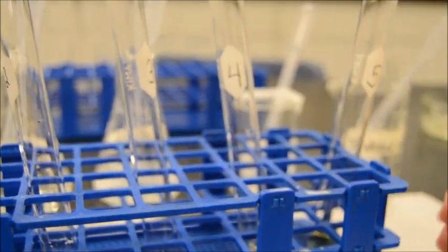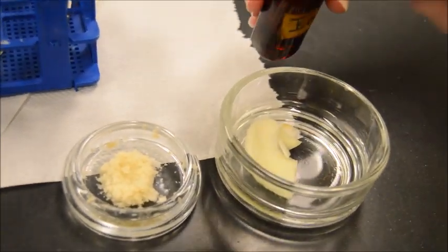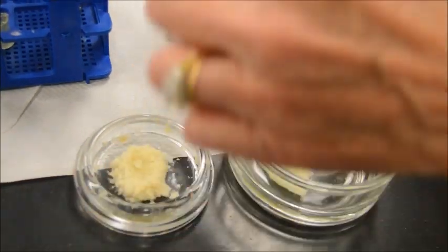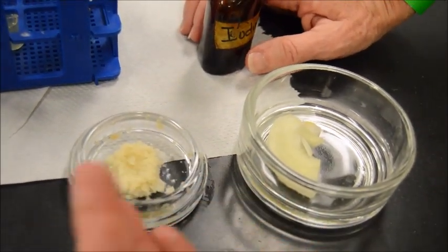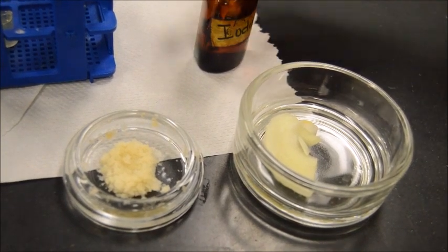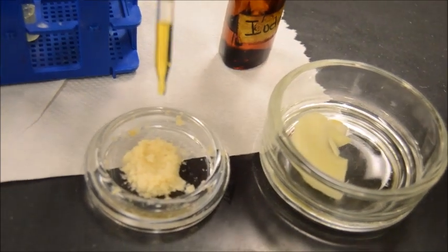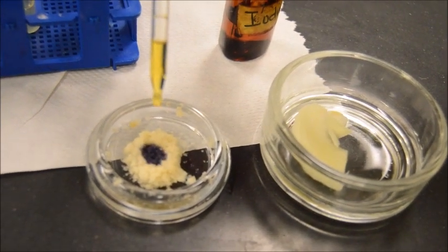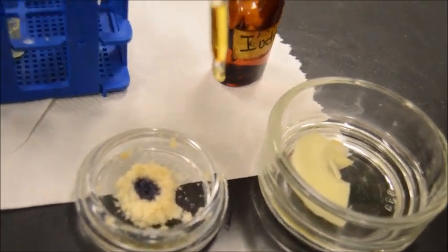Let's check out our potato and our onion. Now, remind us which one's which. The idea is we're just going to drop some iodine on top to see if there's a color change. On the left is the potato, and on the right is the onion. Again, the glory of iodine is it's a very obvious reaction. Here we go, potato, wow. That's just one drop. It probably wants more than that, but I think that's pretty conclusive.